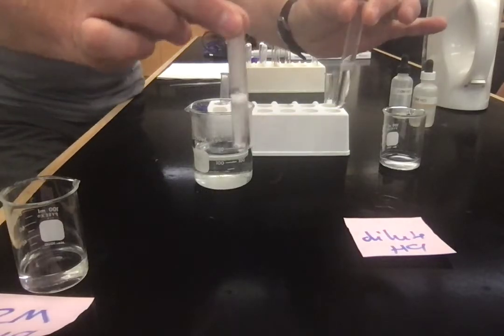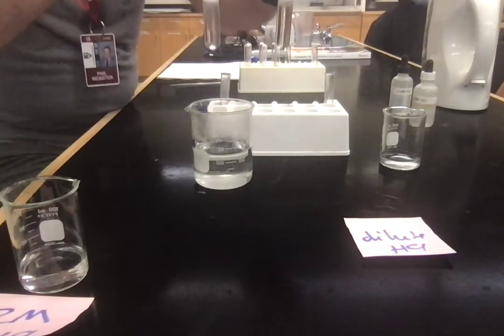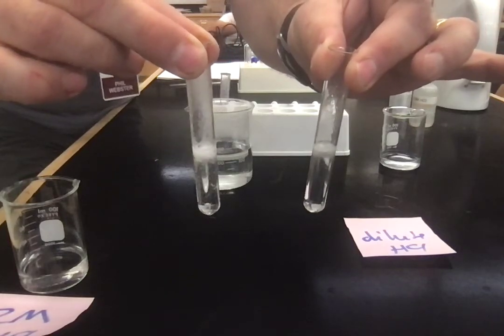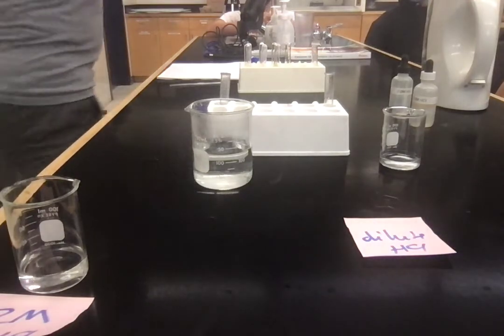Hot one? They're more bubbly. Yeah. Both staying on the surface kind of a little bit. They'll probably both sink in a second. So can I have my view of the... Can you see? You can move to where you need to go. I can see. That does make sense.